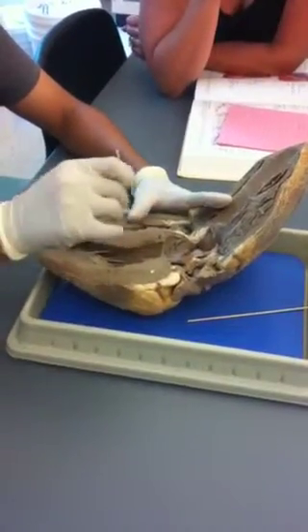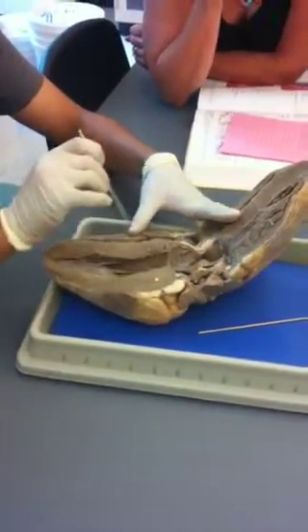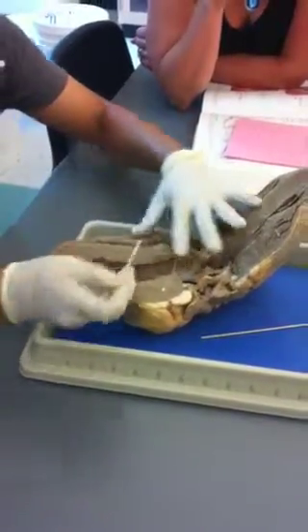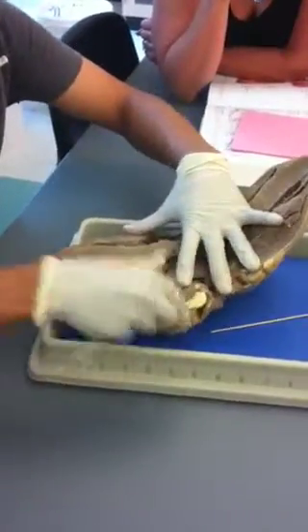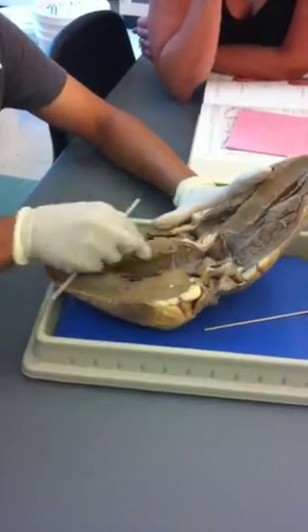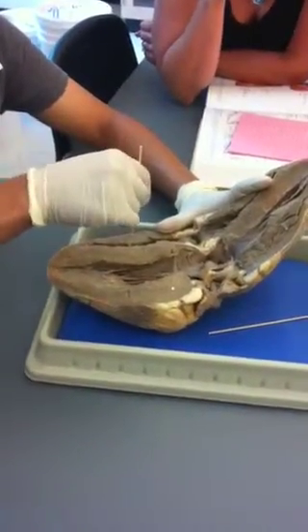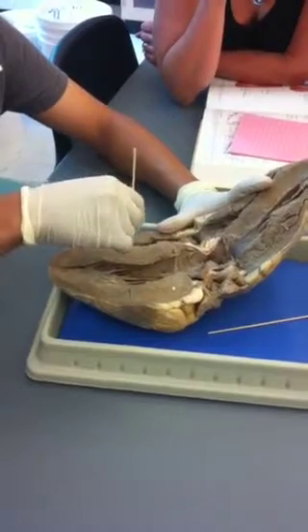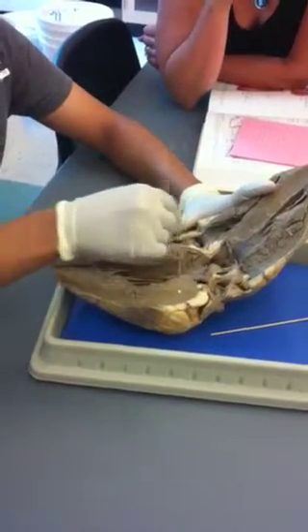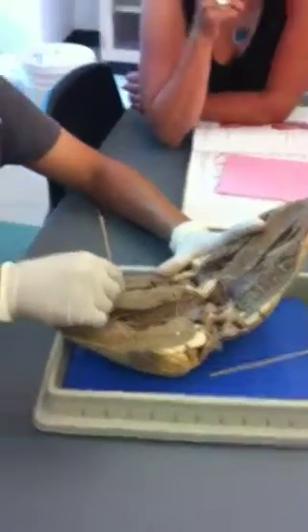So now you know that this chamber over here is your left ventricle, and this chamber over here is your right ventricle. And this would be your interventricular septum. Please don't say myocardium in the exam — if they ask you what structure this is, we would say interventricular septum.